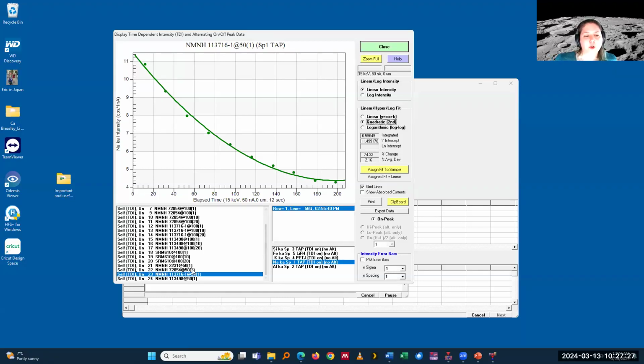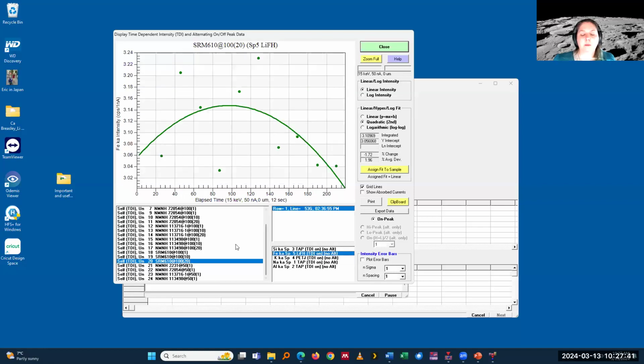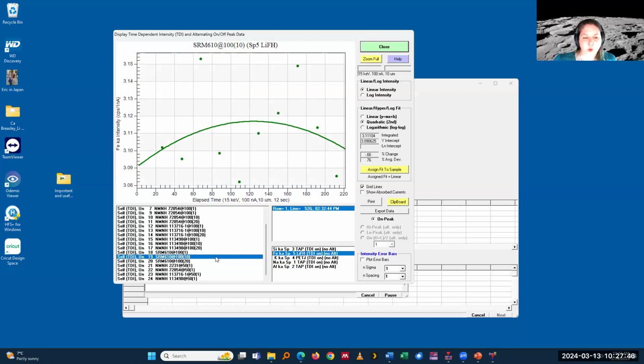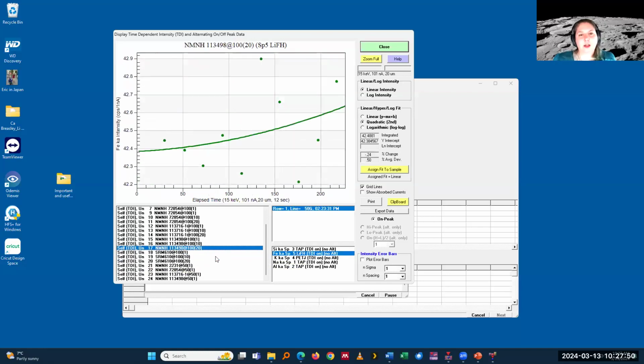So usually my workflow then is just to apply or remove the TDI corrections and then go through each analysis and find the right fits for them. And usually if it's normal analysis, iron or something doesn't really ever show it unless it's like trace element analysis. Although you see here when it's really aggressive, you see it.